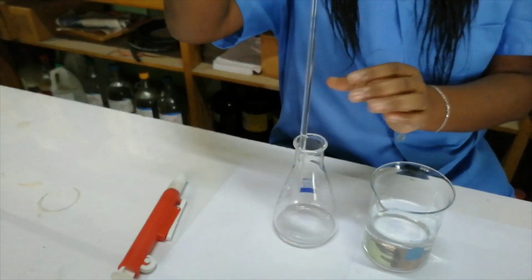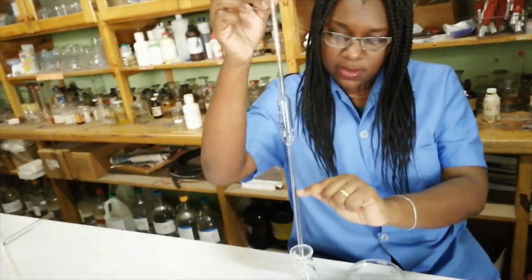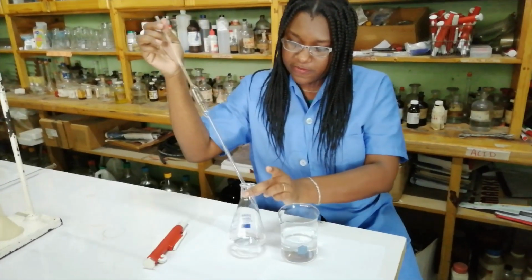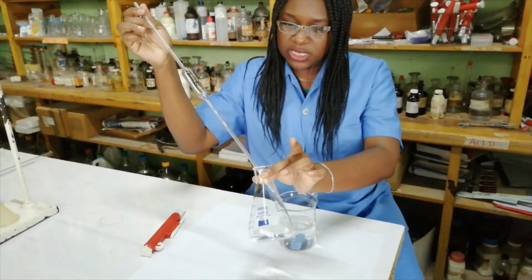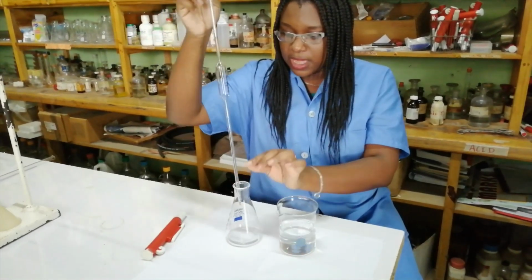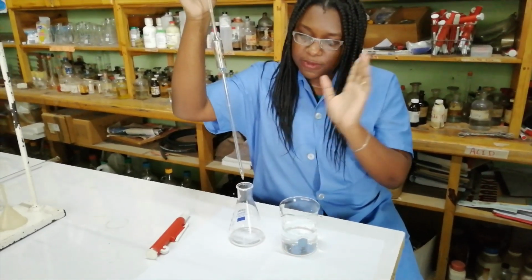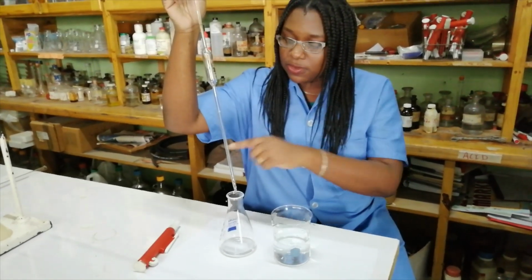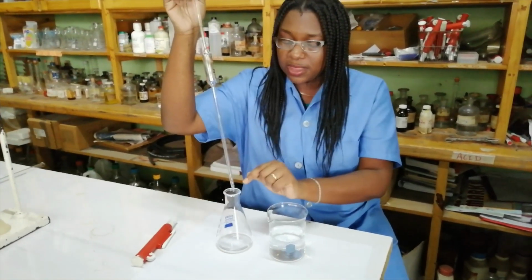We can twirl it so that a vortex is created. However, when it reaches about here, then I'm just simply going to touch the pipette to the side of the conical flask and it drains it properly. This drop that you see in here, you're not supposed to jerk the pipette and try to get it out. Do not blow into the pipette to try and get it out. Do not attach the filler to the pipette to try and get it out.